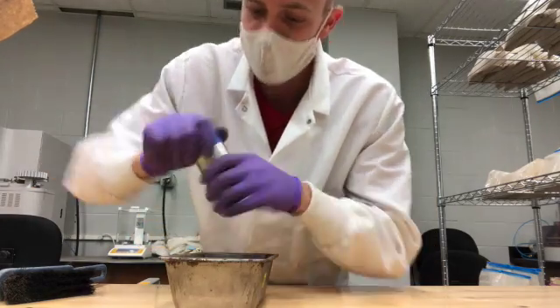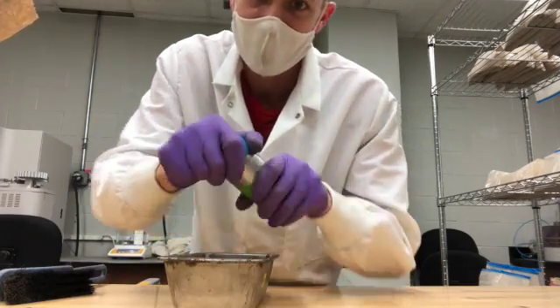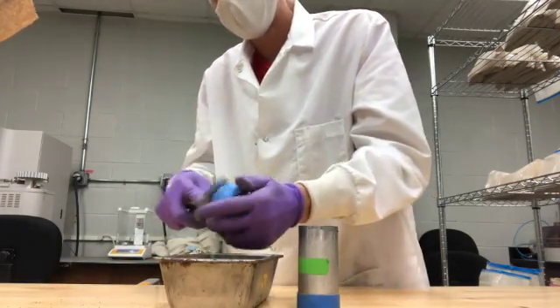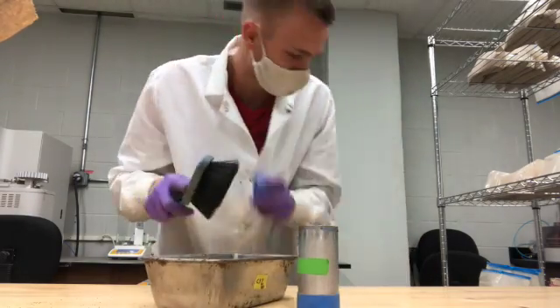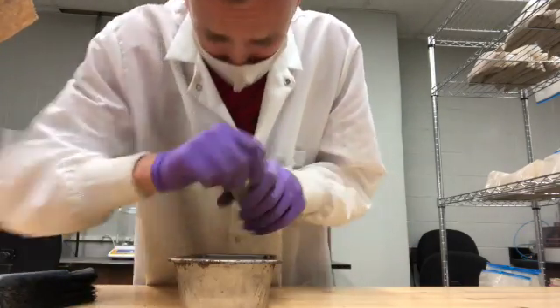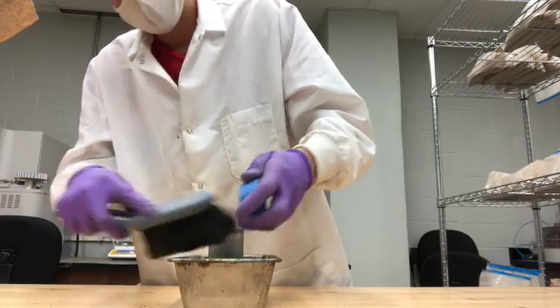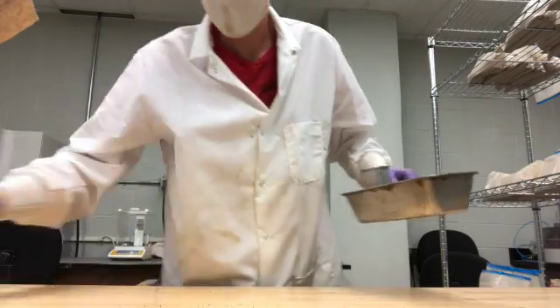You've got to get the lid off, and it works best with gloves — I found that out. You can take these caps off; before, we'd take a screwdriver and pry it off, but this just pops out — except I flip soil everywhere. So you've got to get your little brush and brush whatever's stuck to the lid so there's nothing left in there.